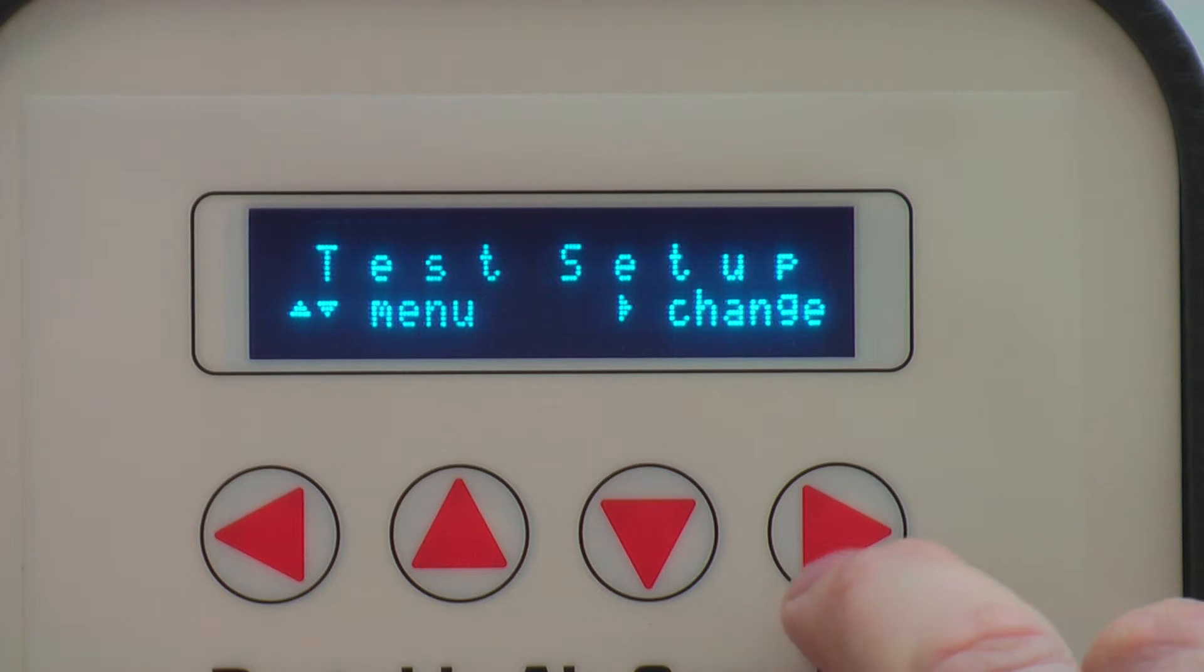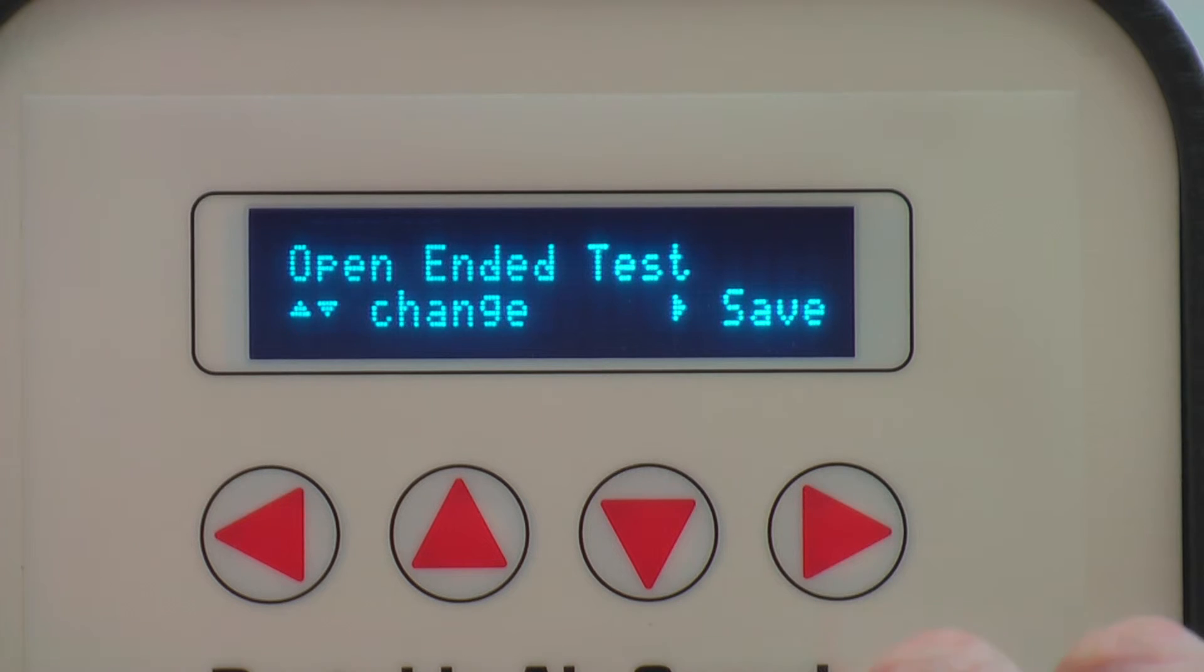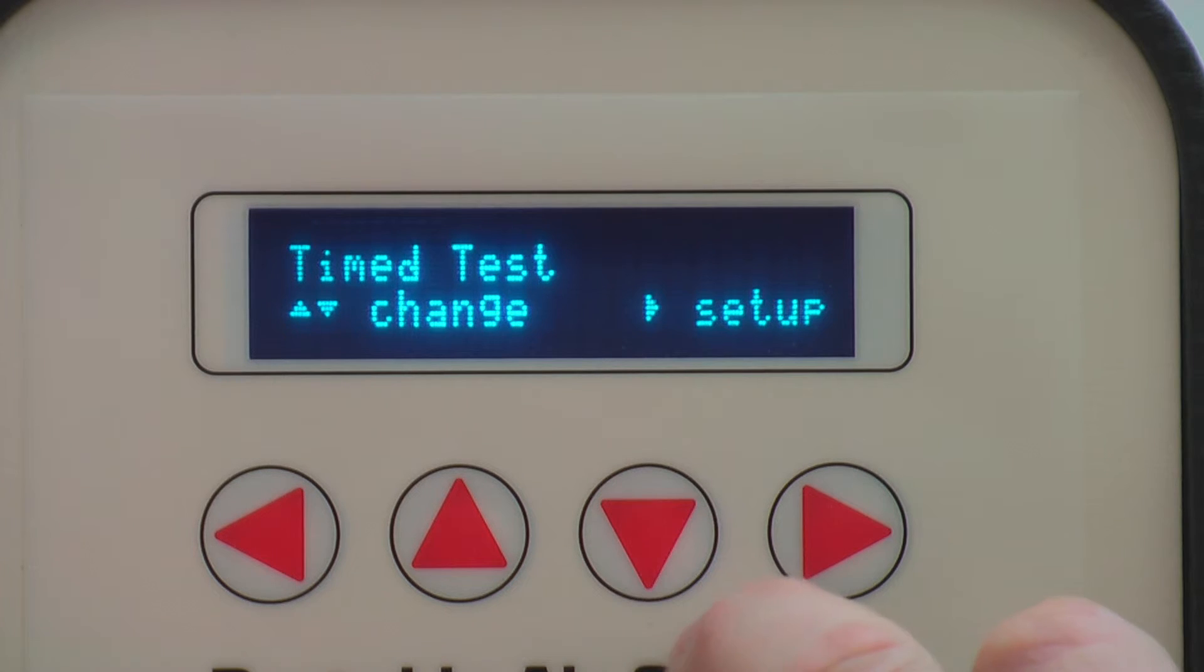Once the generic settings have been configured, you can then move to the test setup. Press right to bring you to the different options available.